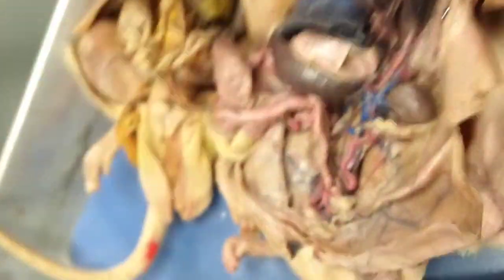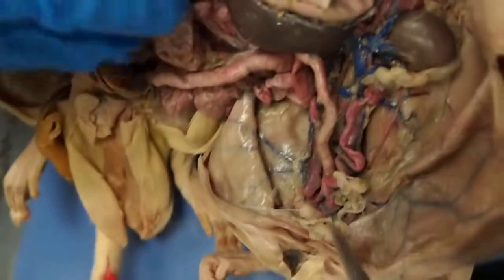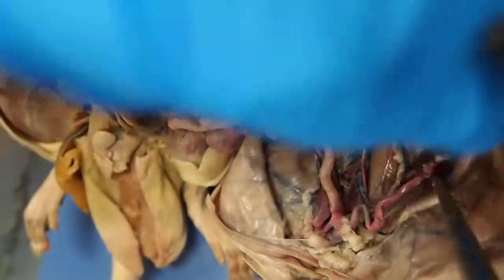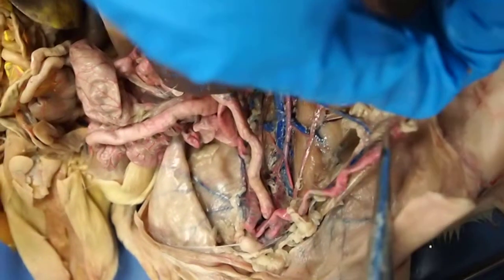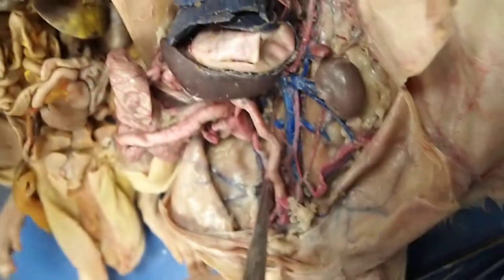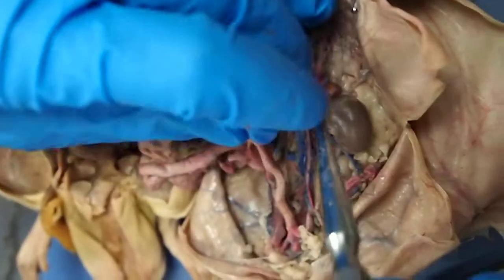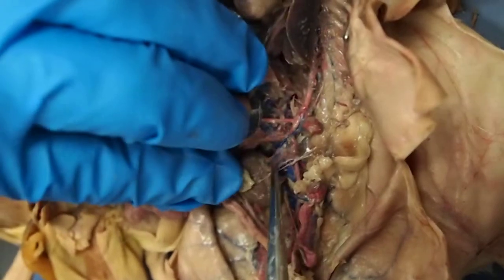Then let's see, this is a female, so we want the ovarian arteries. So here's the ovary. Basically, we want to find the connection to that. So you can see the one going along the uterine horn towards the ovarian bursa. This one is the ovarian artery. In the male, that would be the testicular artery, which goes to the pampiniform plexus, which you guys learned last time. Renal artery is the artery that connects to the kidney, right here.